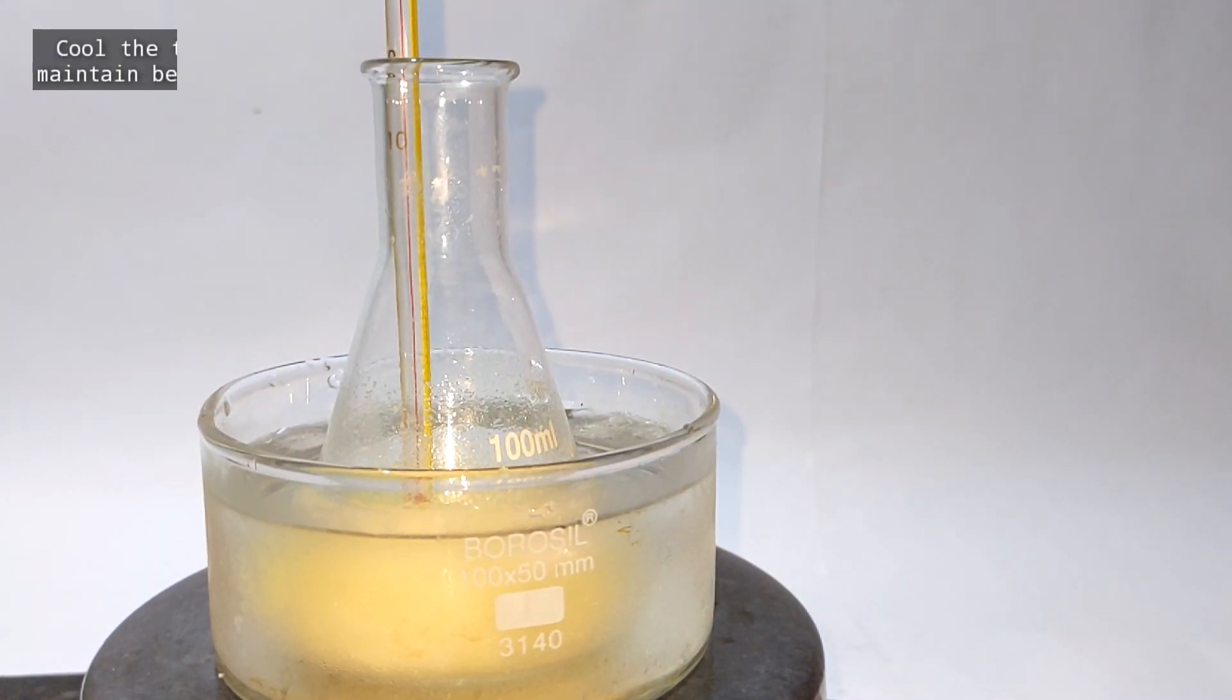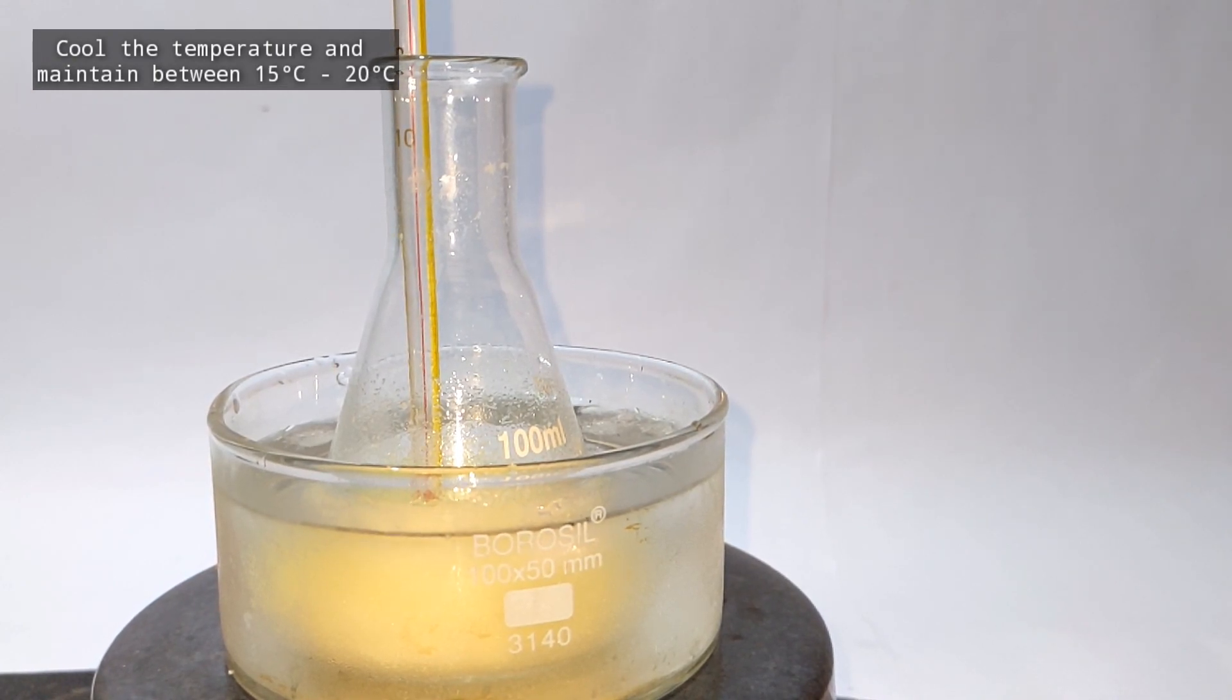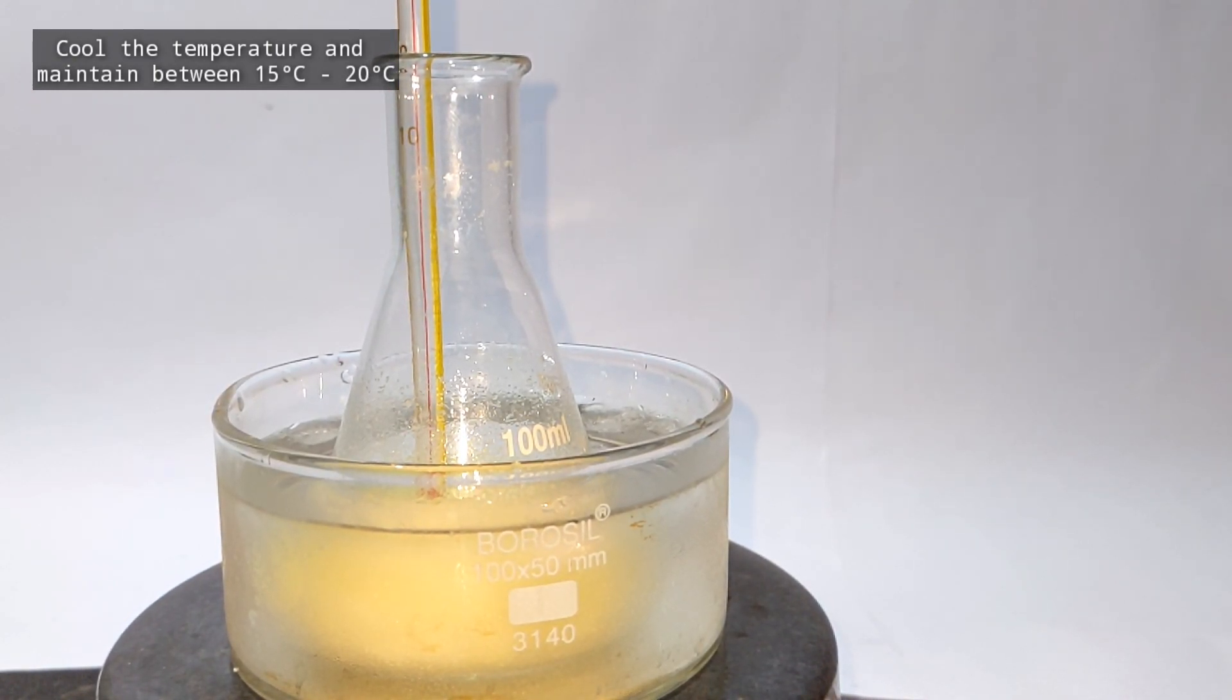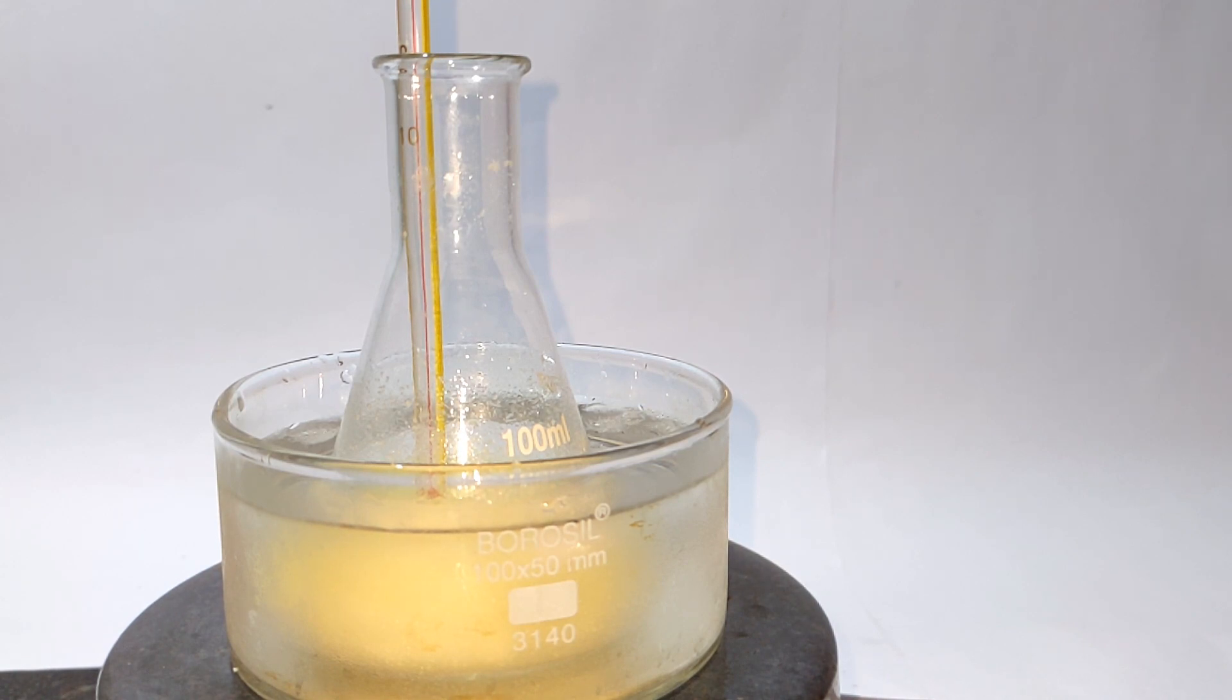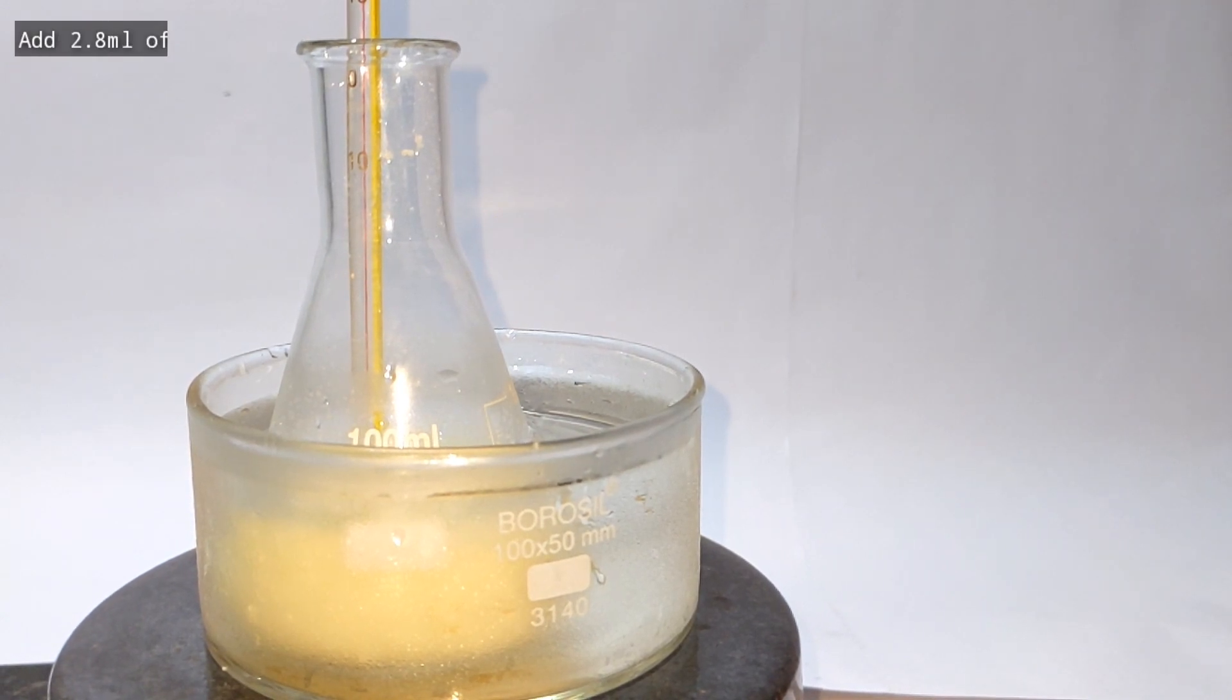Now this flask was placed in a cold water bath and the temperature was maintained between 15 and 20 degrees Celsius. Continuous monitoring with a thermometer is absolutely necessary.